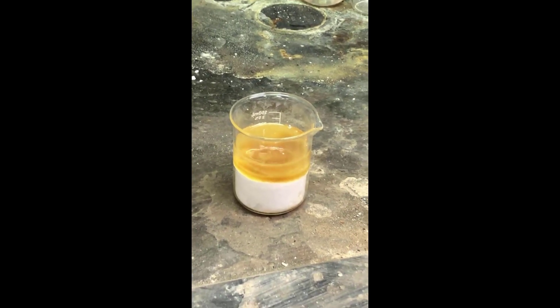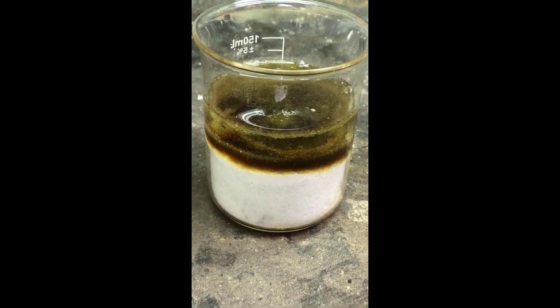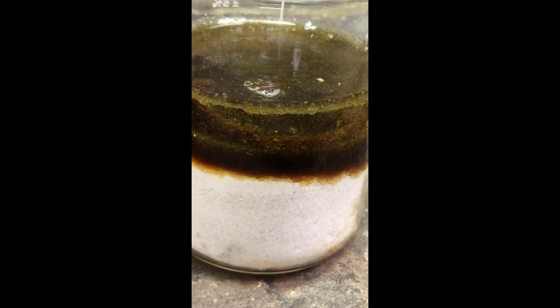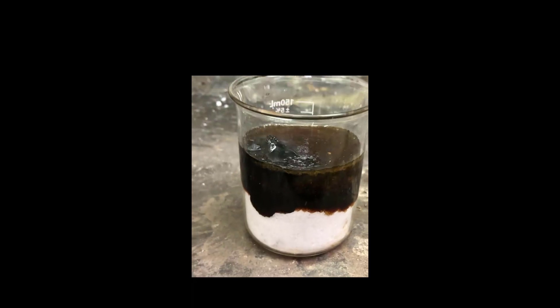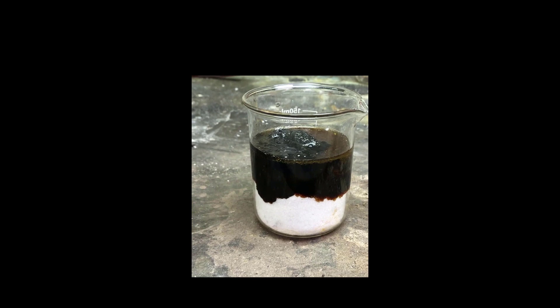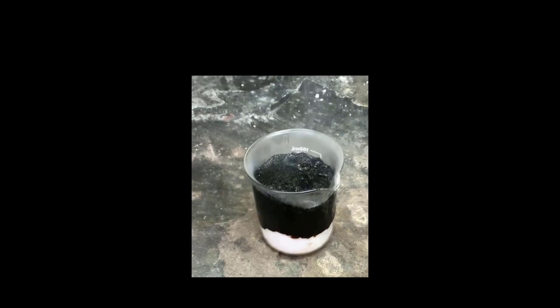You might as well stand back a little further since you don't have goggles on. Okay, here goes. It's like the creature from the black lagoon. It did look very tentacle-like. You can take it over — come on, just get it off.